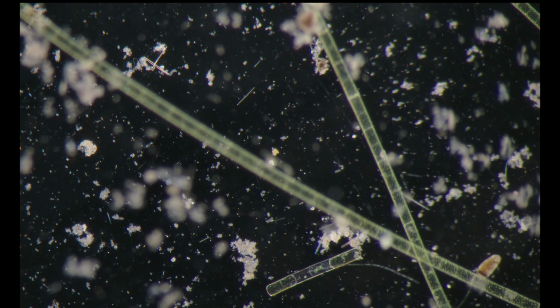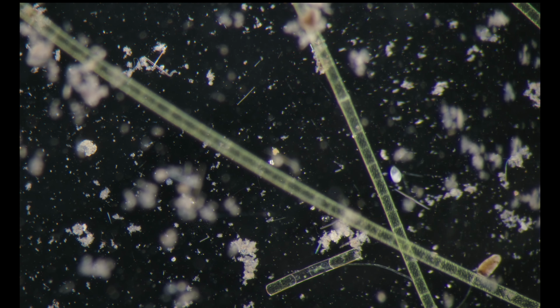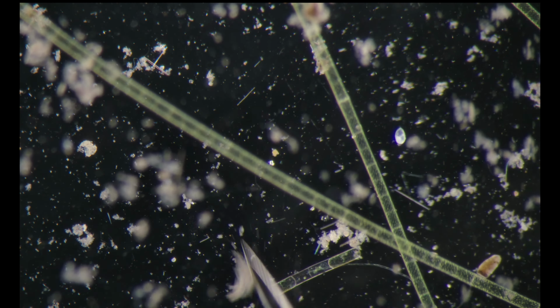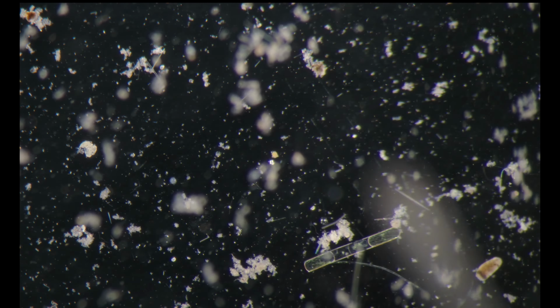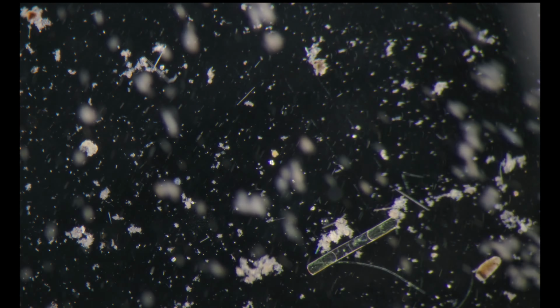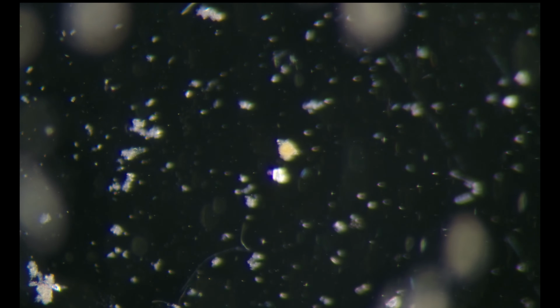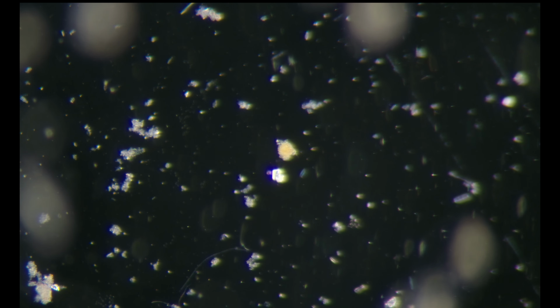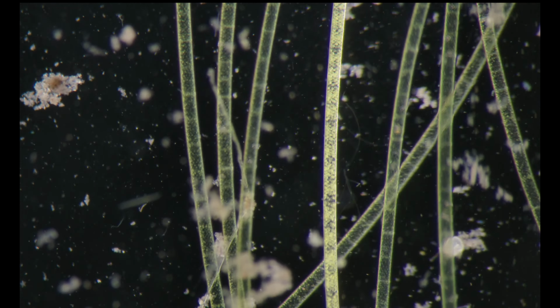So I'll take my needle. Oh, it's right on the edge, so I have to be careful. Yeah, I think it is. What else?